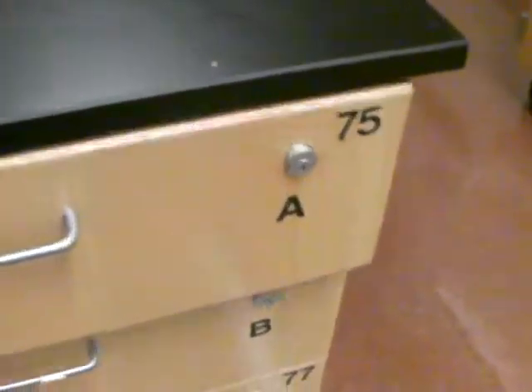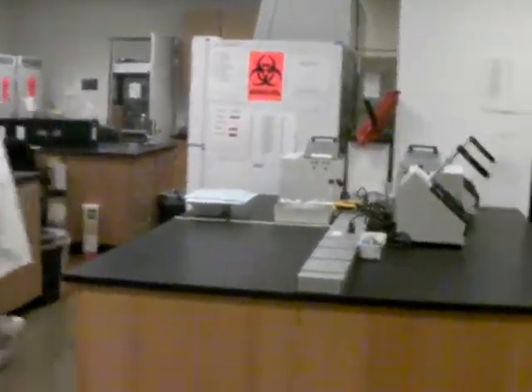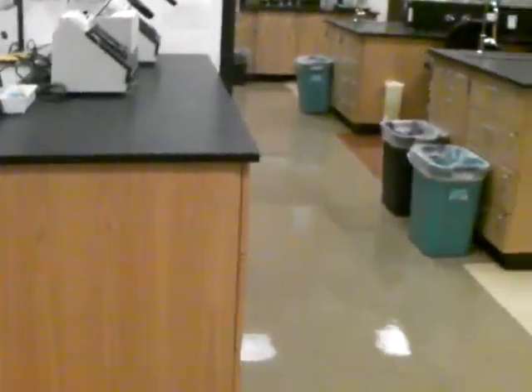You will have some other supplies in drawer A — staining trays and racks — and in drawer B, more racks. On the side you can find your Bunsen burners. The first day is going to be a lot about finding your place, what you are going to need, assigning papers, assigning microscopes, and other instruments. And here is Sam — he's going to be your helper in the lab. With this, I welcome you very soon in class. Bye!